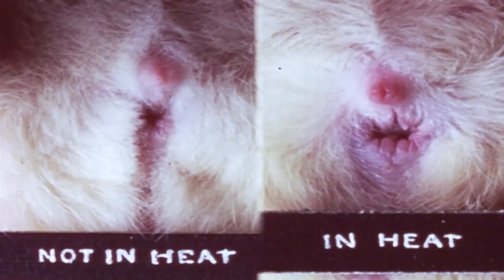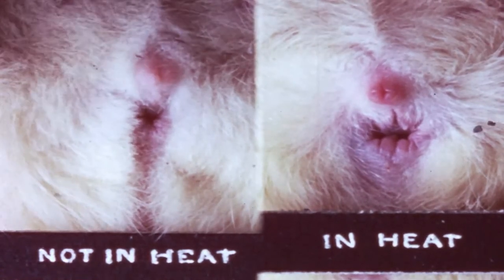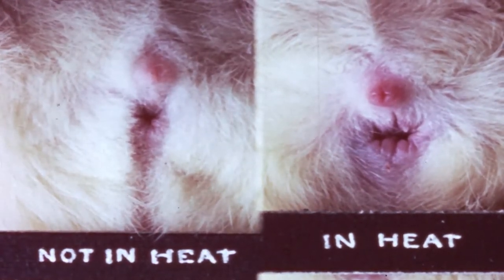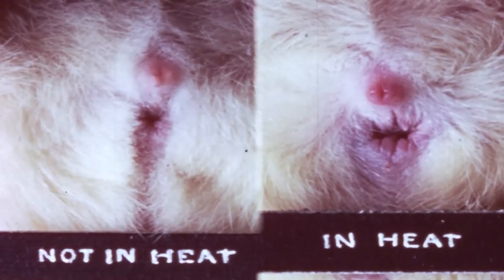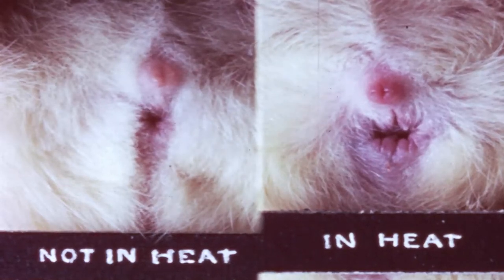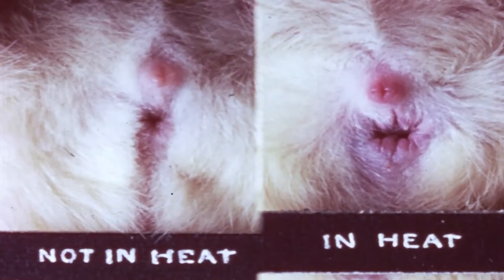Still another change which may be observed externally as the period of heat approaches is the tumescence and coloration of the folds of the external vaginal orifice. Several hours before the onset of heat and during heat, the folds become swollen and engorged with blood, giving them a bluish color compared to an animal not in heat. The tumescence of the vaginal folds is a useful method for predicting which females in the colony will come into heat during the succeeding hours.